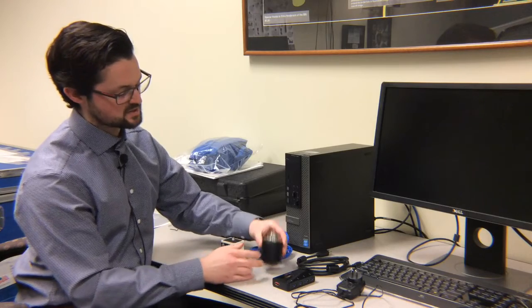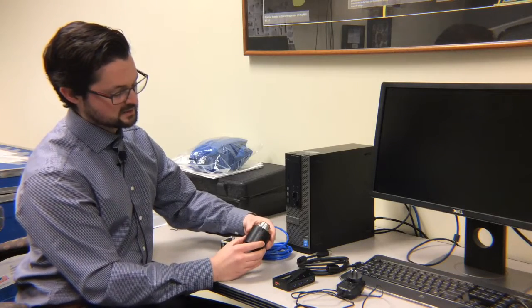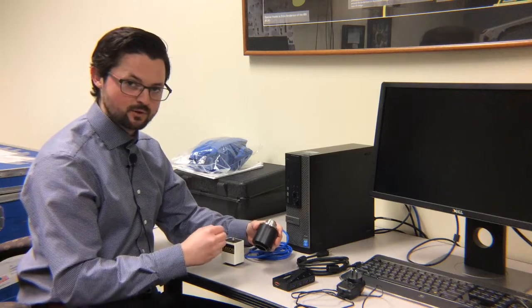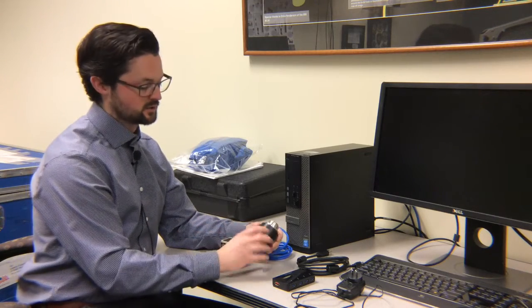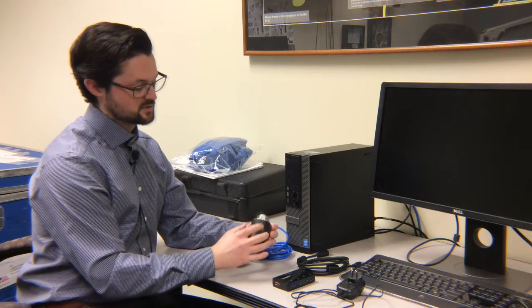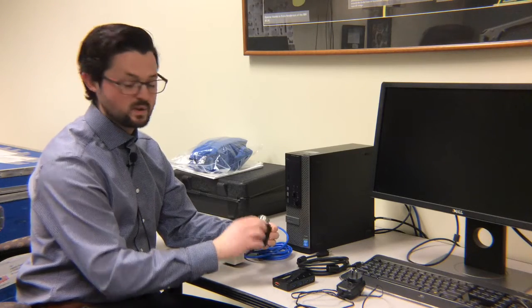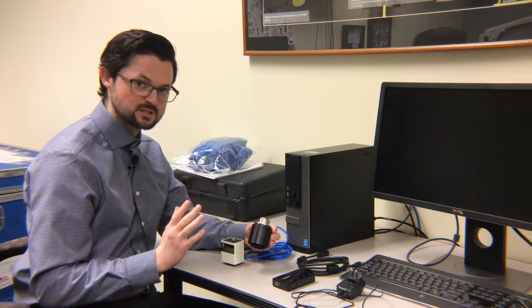I want to make sure you have the C-mount camera adapter. Leeds, as part of our quality control, has spent time par-focaling this camera to this adapter. You'll notice there are some set screws, two set screws around the side of the C-mount adapter. We've locked those in. Please don't adjust them.